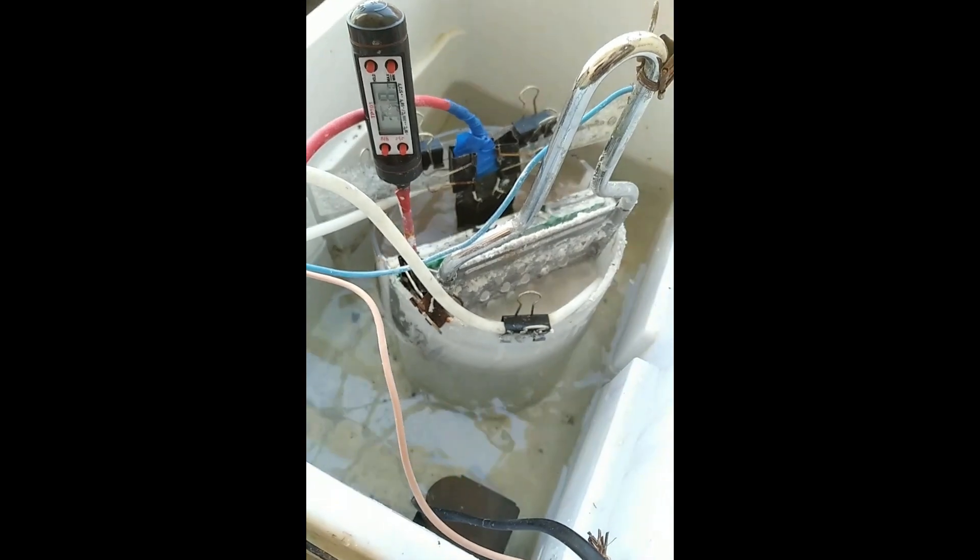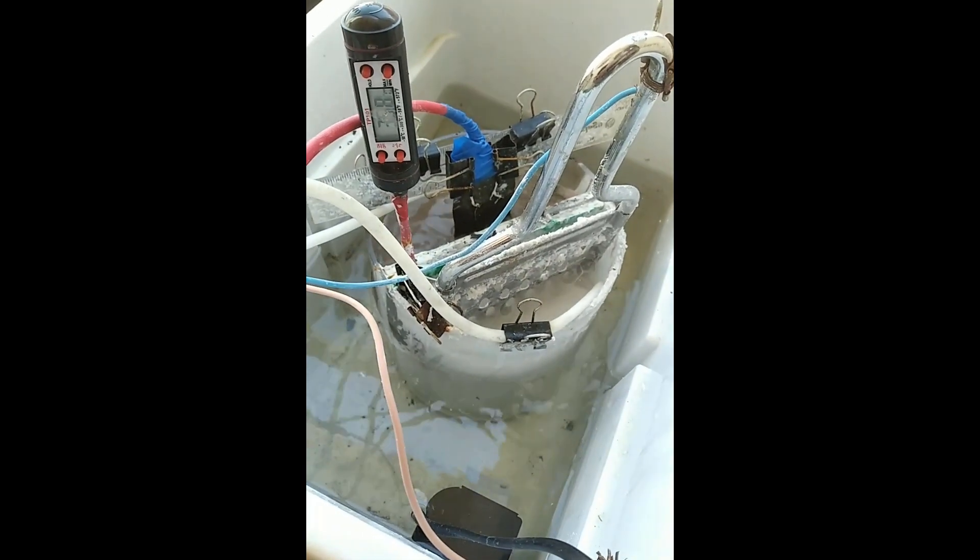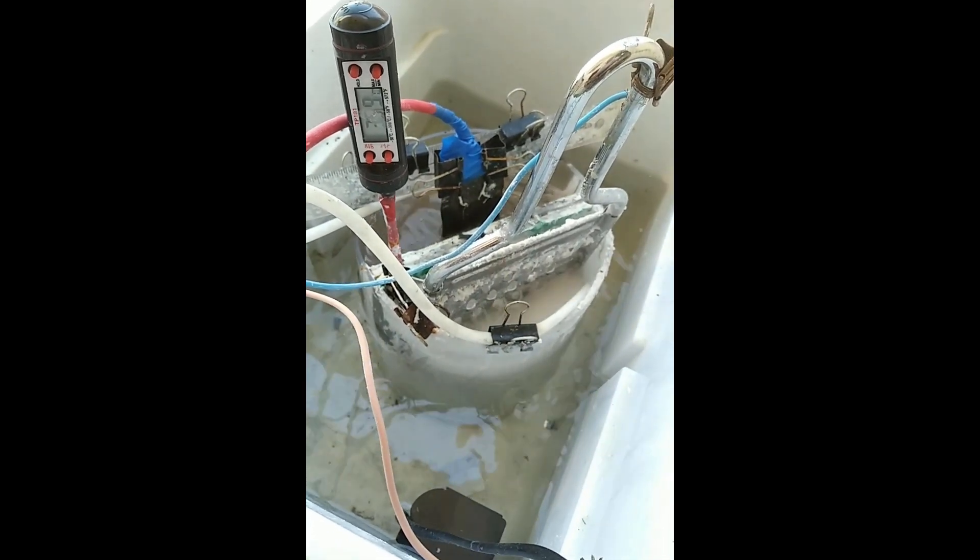All this madness to make a bit of sulfuric acid. It's running at 12 volts and these bubblers prevent the cell from getting too hot, which actually damages the polymer composite electrode.